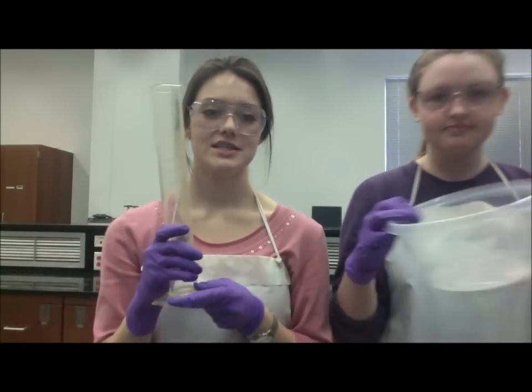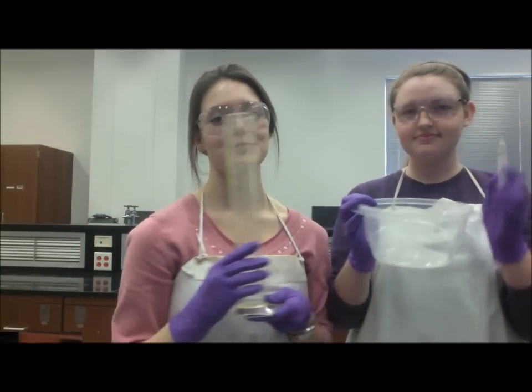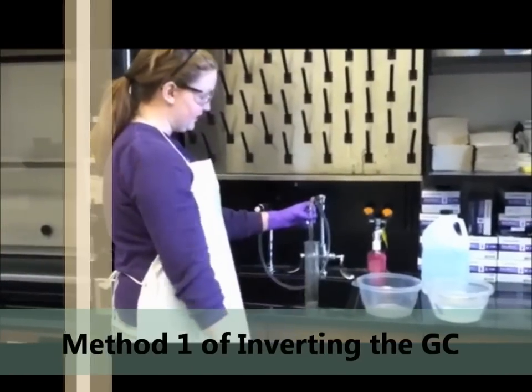So you grab your graduated cylinder, the bowl, and the syringe. And now we'll show you how to set it up. There are two ways of inverting your graduated cylinder.